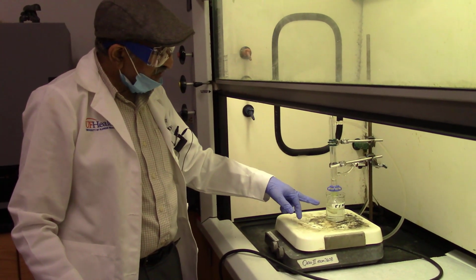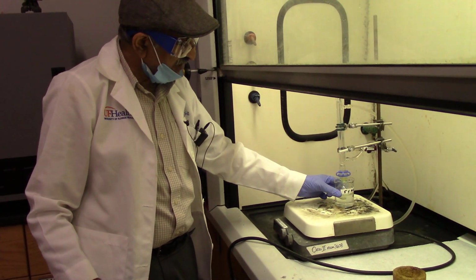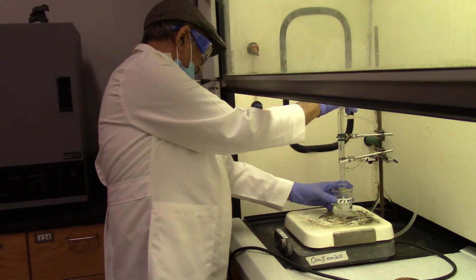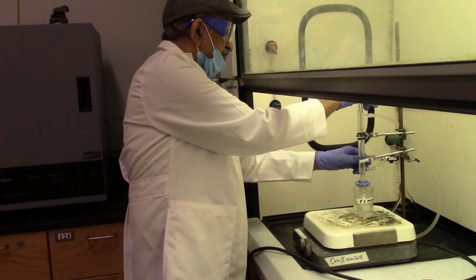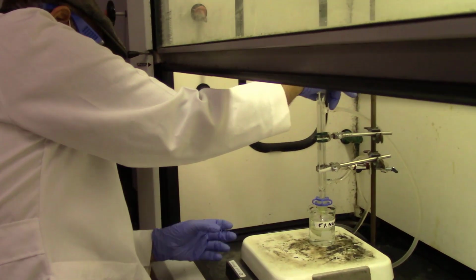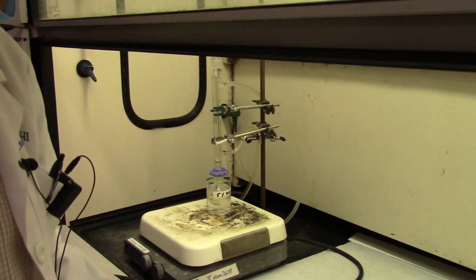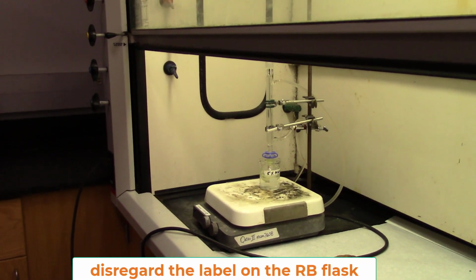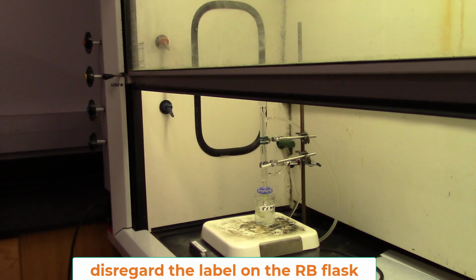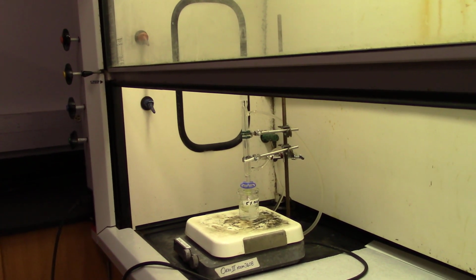Okay, so we have been trying to dissolve this cinnamic acid in DCM. It's a little bit difficult to do that, but if you heat it at 50 or 55 degrees using a condenser, with the condenser you have to circulate water from the lower port and the water should leave from the upper port. So we are basically refluxing this using a water condenser. So this solution is being heated. So hopefully it will dissolve at 50 degrees.